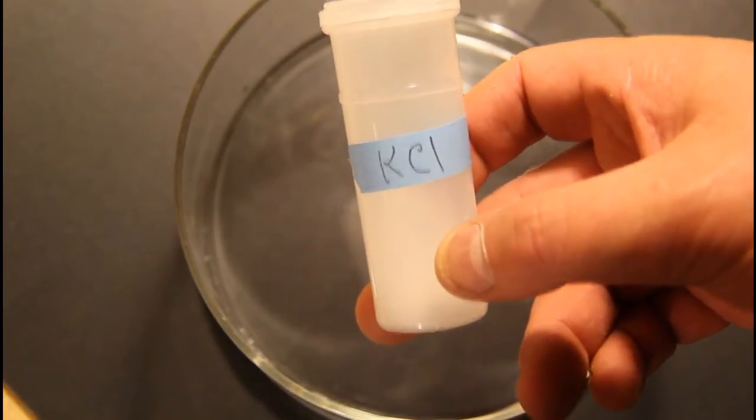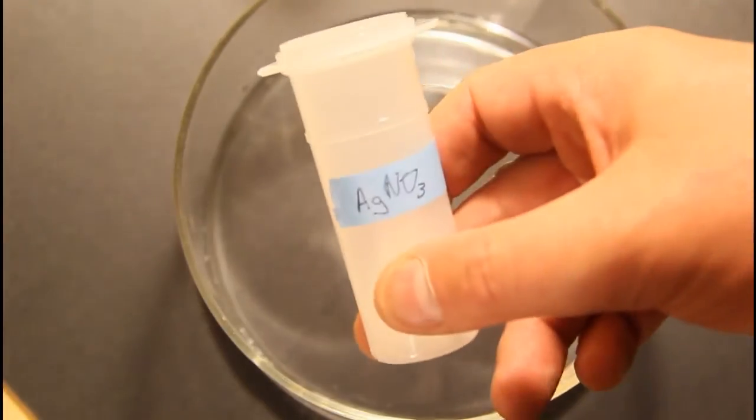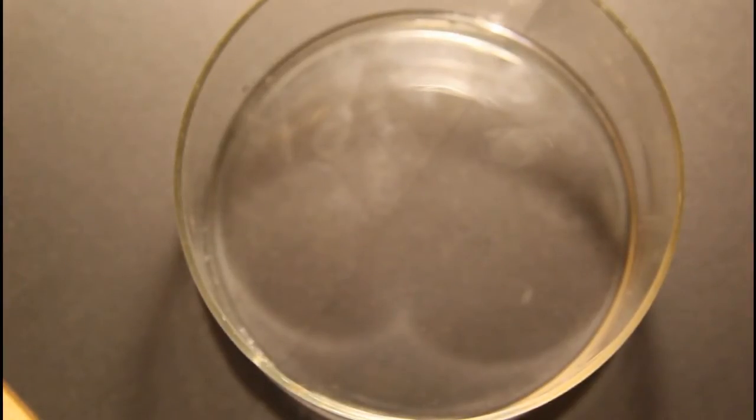Now potassium chloride and some silver nitrate. I'm going to add them both into the water at the same time and watch what happens. I'm not going to mix them.